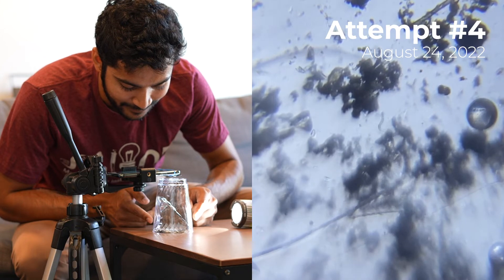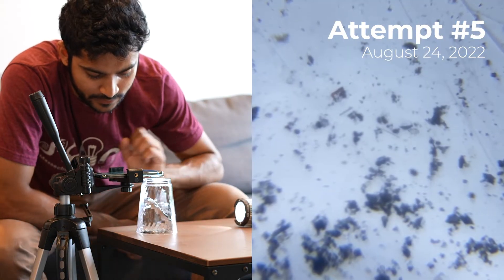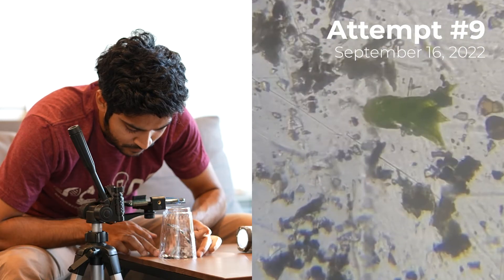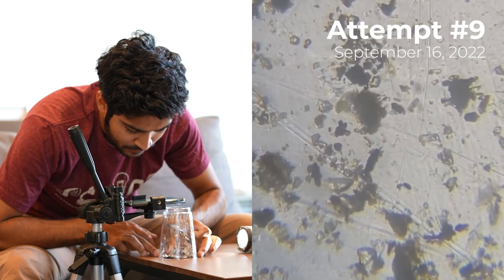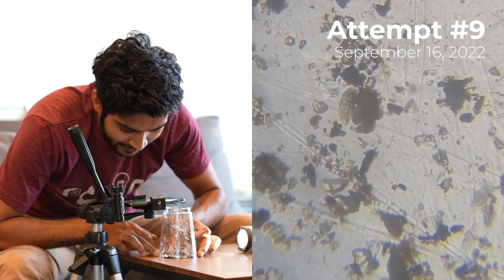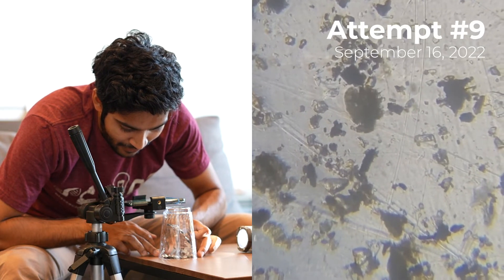Oh, look at this worm thing. Come on. Oh, no way. No way.